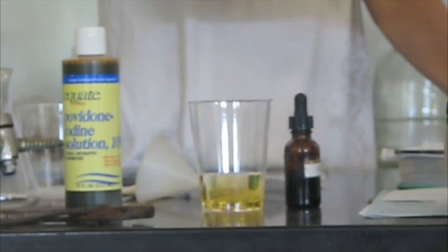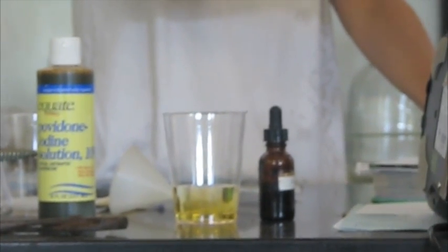So the spit, I'm going to mix it up. Is the iodine in our mouth? The iodine... No, no, it isn't. And overall, it didn't really change color.